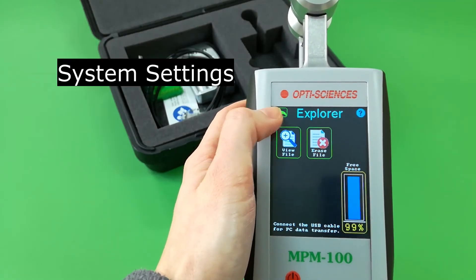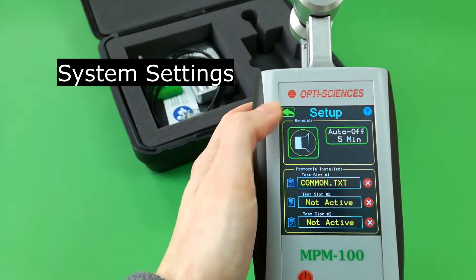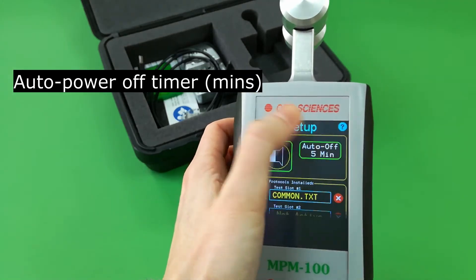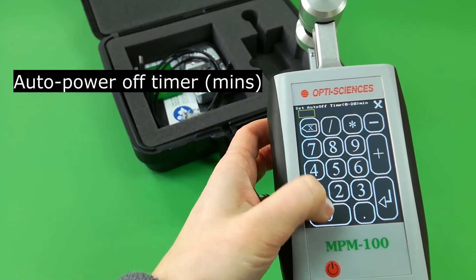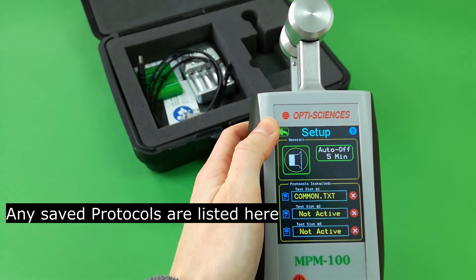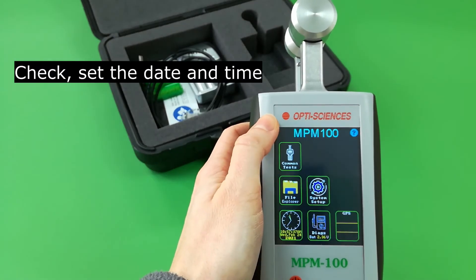Press system setup to view and edit settings. Turn system sound on or off, and set the MPM auto power off timer in minutes. Any saved protocols are listed here. Check and set the date and time here.